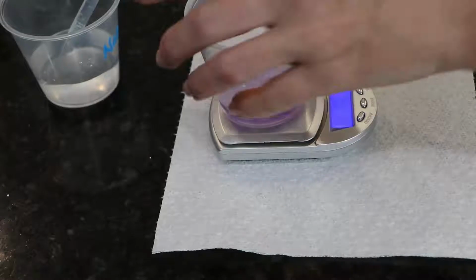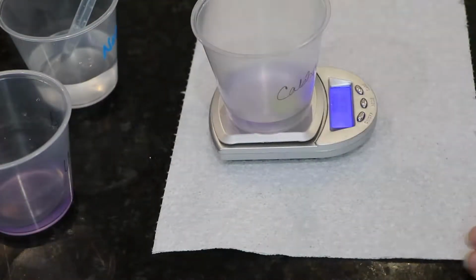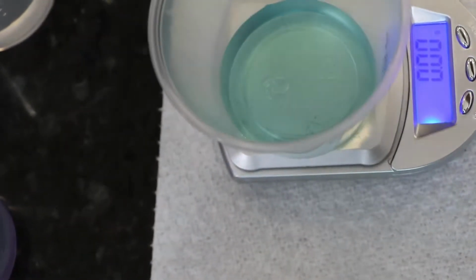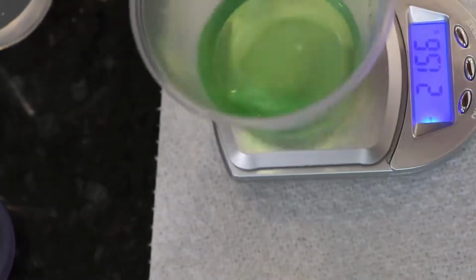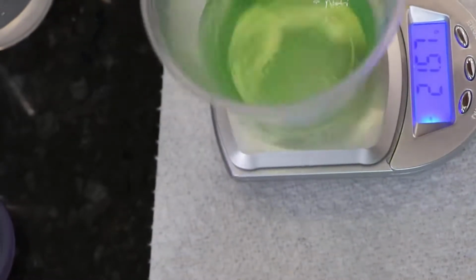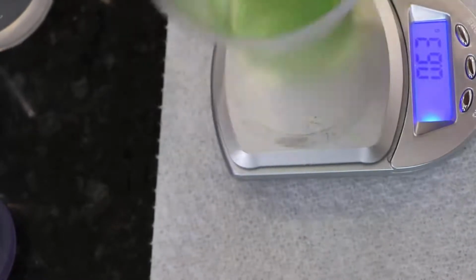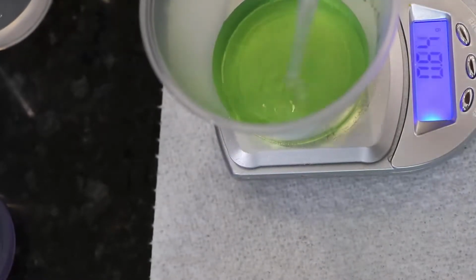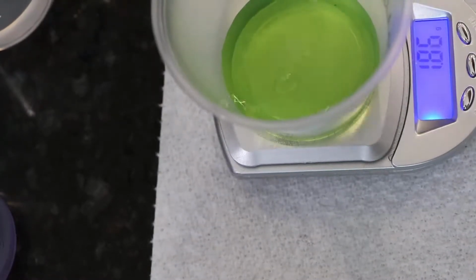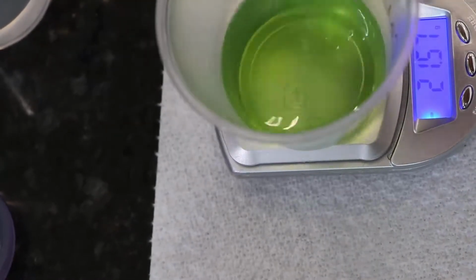Then for the second trial, we're going to start over by taring the new beaker and then adding my sodium hydroxide. Now again, the Cabbage isn't going to have a T1 point, it's only going to have T2, but you see that transition from purple to blue happens quickly, and then we go from blue to green. But what we're looking for here is more yellow. And you need to watch this, because once you hit green, the difference between green and yellow for me was 2 drops, and the camera didn't actually pick it up real well.